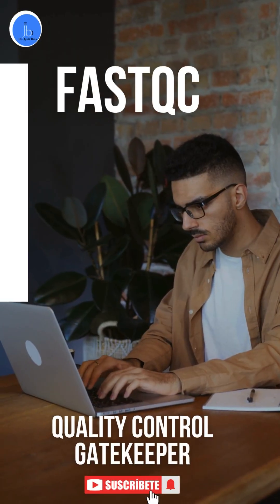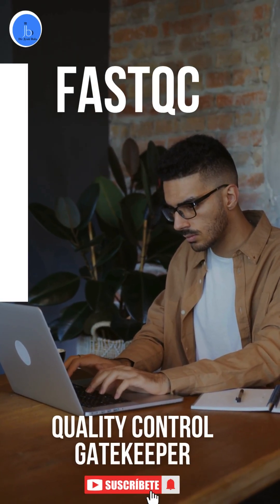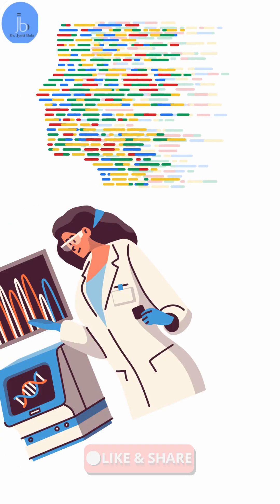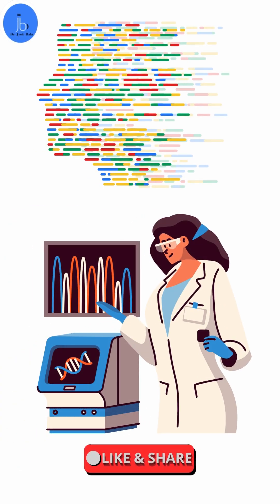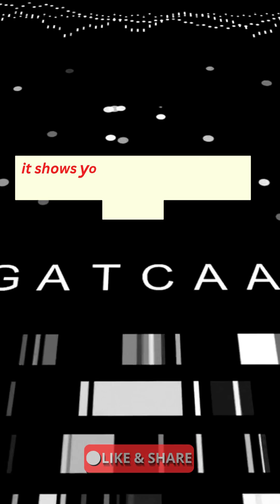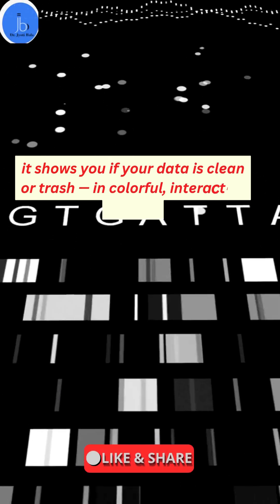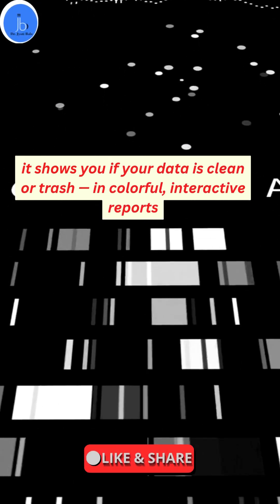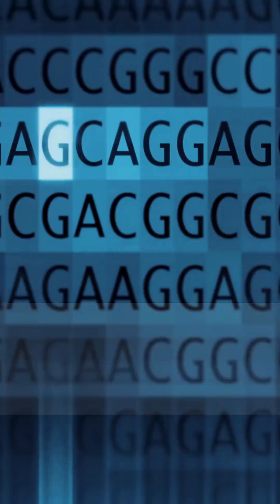The first one is FastQC. It's your quality control gatekeeper. You just drop in your FastQ file and it'll show you if your data is clean or trash — all in a colorful, interactive report. Use it before any analysis begins.